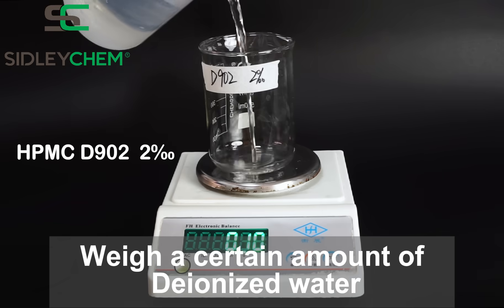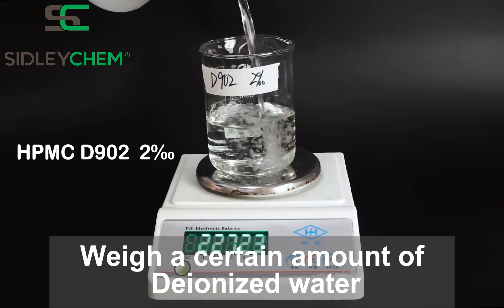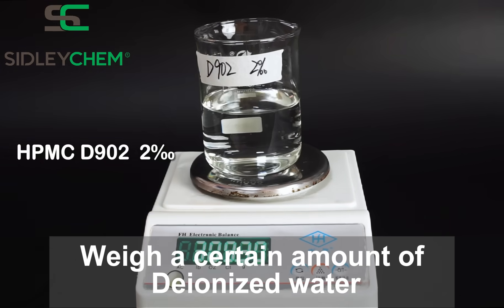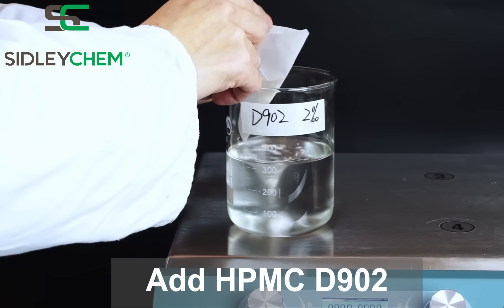Weigh a certain amount of deionized water and add HPMC D902.